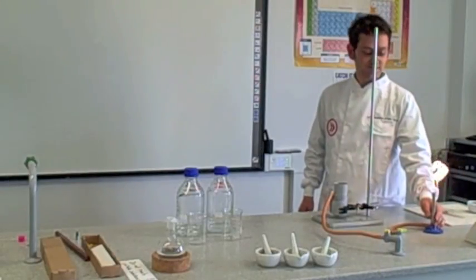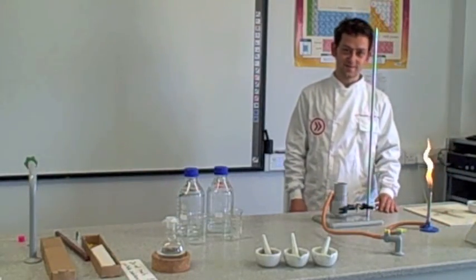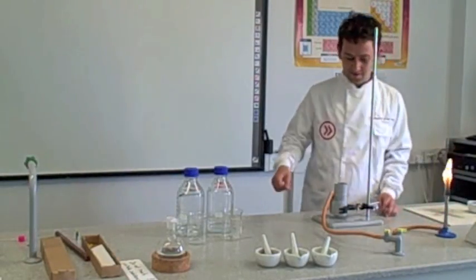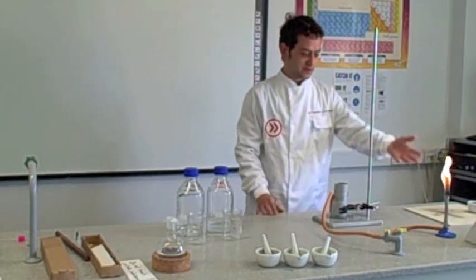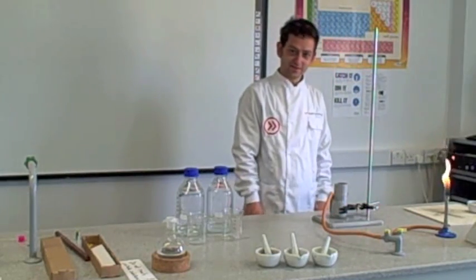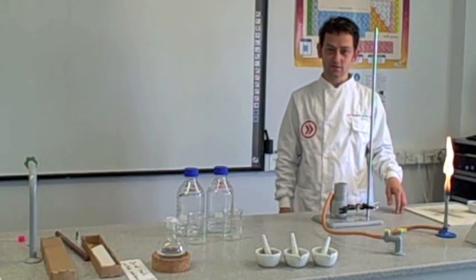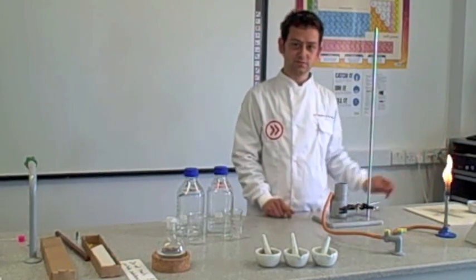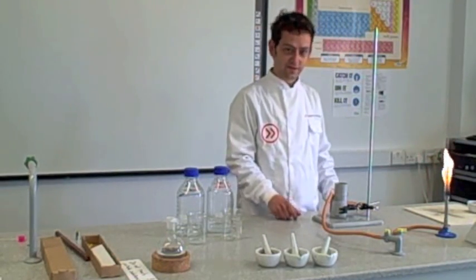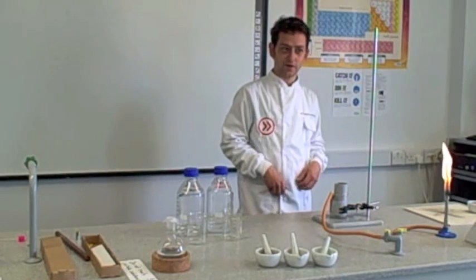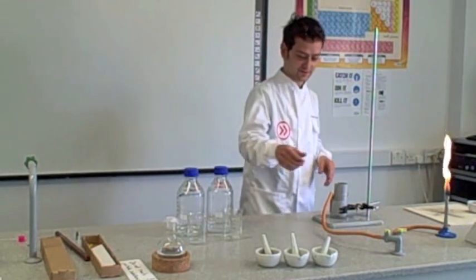As a scientist, I always have a Bunsen burner on in the lab. The Bunsen burner is burning methane gas. This methane gas is combusting and reacting with oxygen in the air. That's what's producing that glow. I can control that in a certain way. Scientists do like to control reactions.